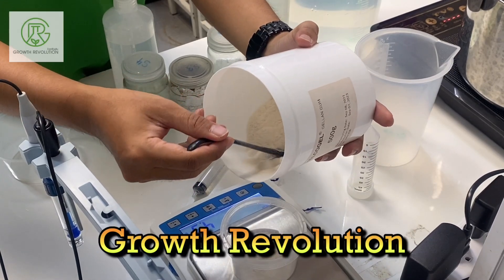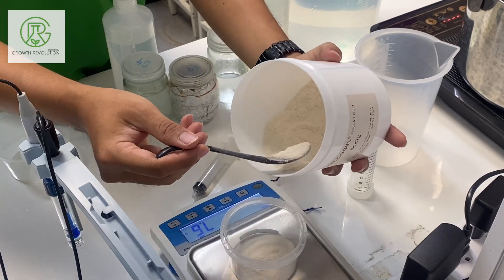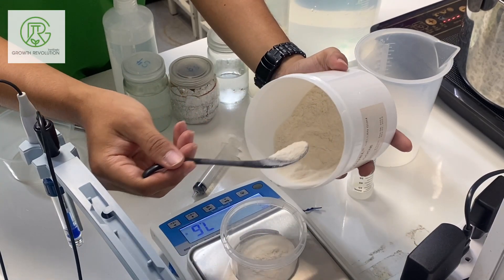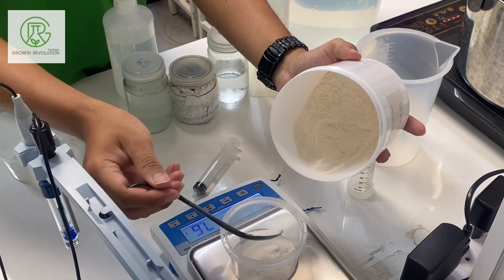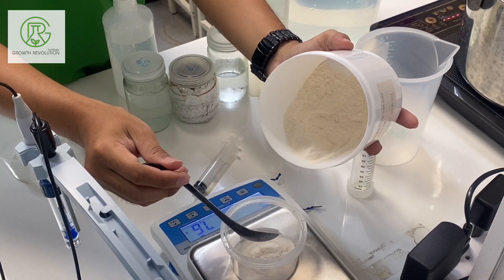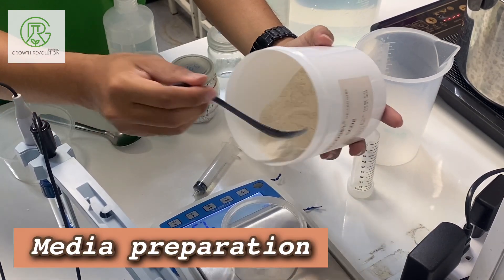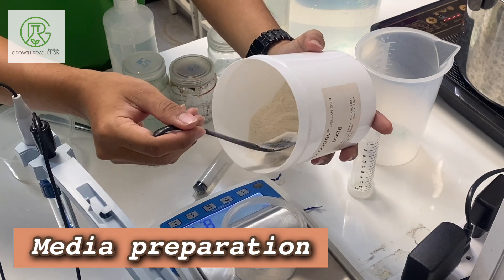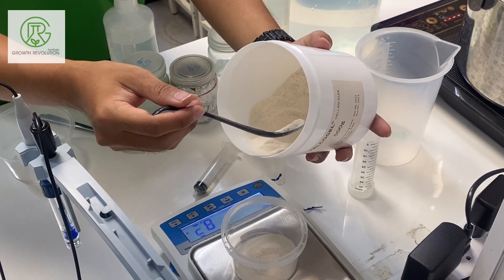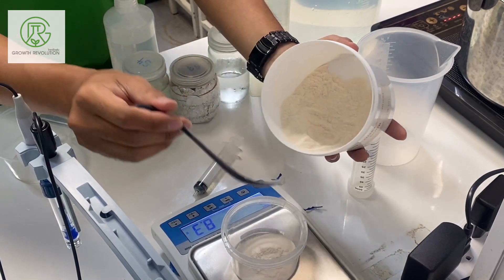Hello, welcome back to Growth Revolution. Today we'll be demonstrating how to make plant tissue culture media from MS stock solution that we made in the last video. First, we are going to measure the gelling agent.